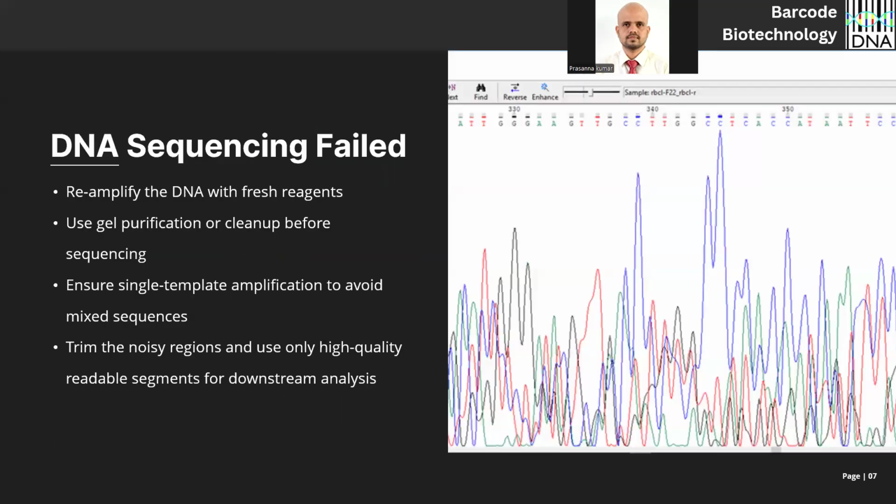Okay. When you have a chromatogram, even at the initial stages, something like around 300 and 330, see the peaks, I would say the sequencing reaction failed. Okay. Why does a sequencing reaction fail?